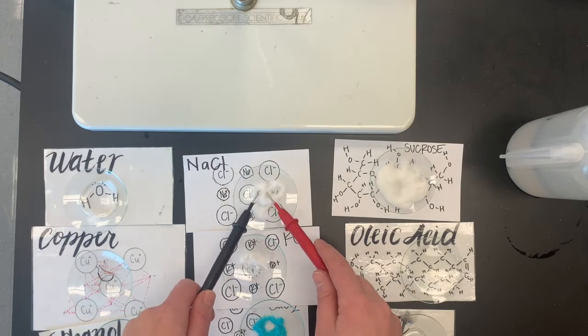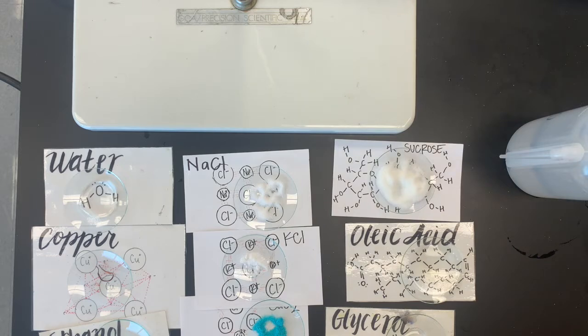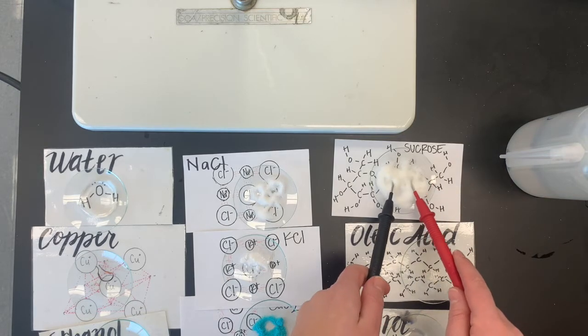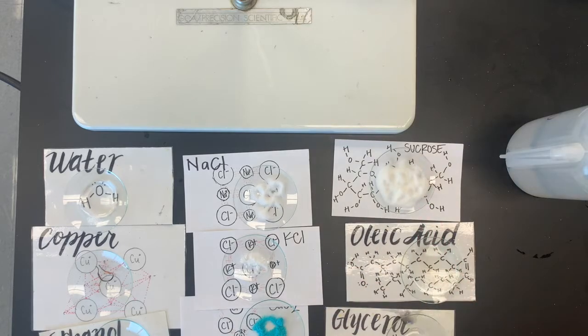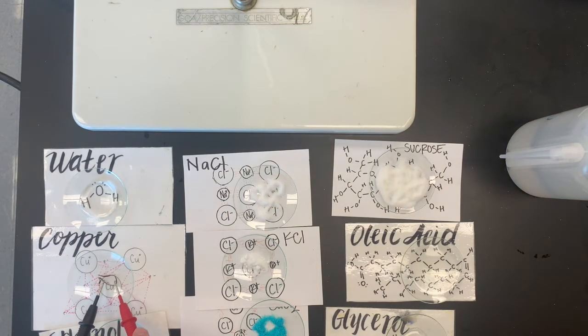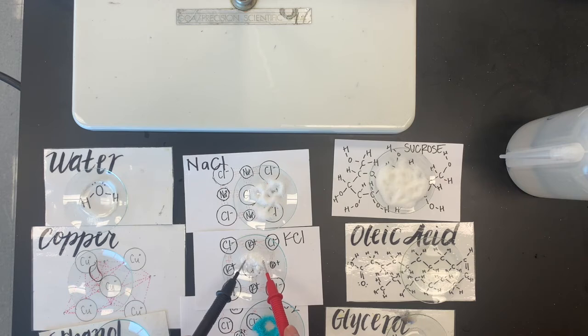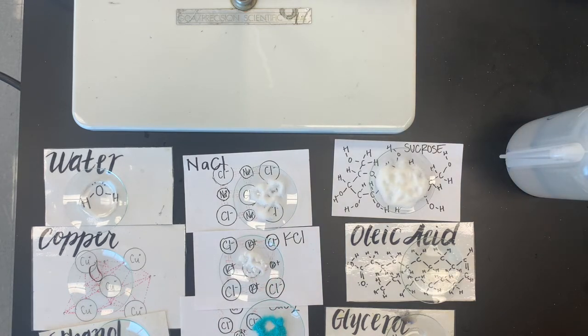Let's see about our sodium chloride. I would say no. I'm going to clean these off. Let's check out our sucrose. It's not going to conduct. I bet we could come up with some reasons why we think that doesn't conduct. Let's try the copper wire. There we go. Boom. I bet we're not too surprised by that one. Potassium chloride. Nope. No conduction. I'm cleaning these off between everyone. I'm doing it off camera. Here's the oleic acid. Nope.